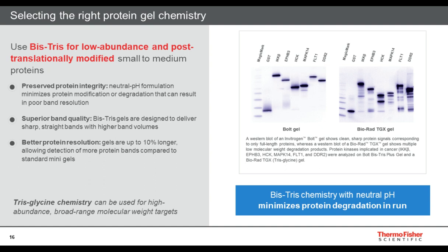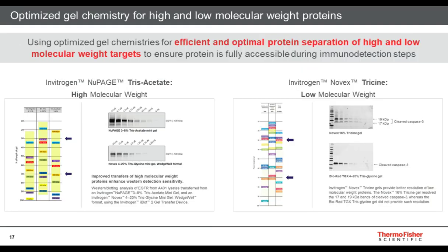In this example, the Bolt Bis-Tris gel shows the preservation of these full-length proteins listed across the top, while the Tris glycine gel from Bio-Rad shows multiple low molecular weight degraded protein fragments. In addition, Bis-Tris chemistries can help achieve superior band quality as they are designed to provide sharper, straighter bands. While we focus on Bis-Tris gels for the detection of low abundance targets, Tris glycine gels, which are a popular chemistry to be used, are certainly useful for detection of high abundant and broad range molecular protein targets.